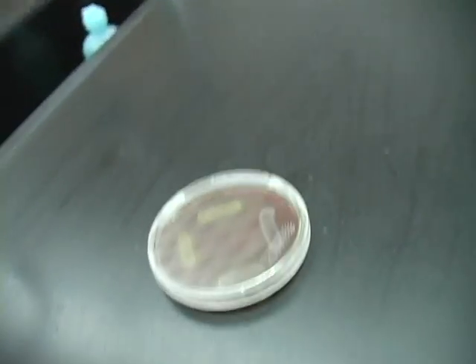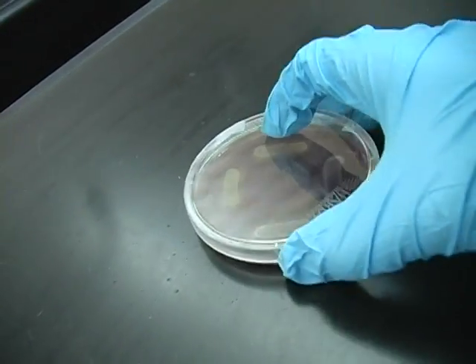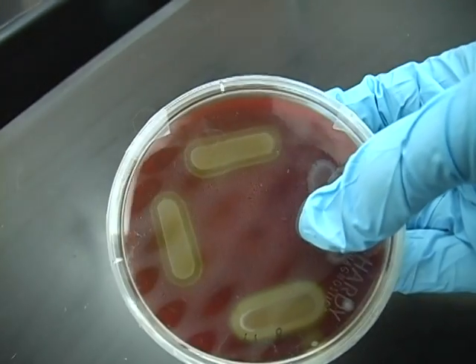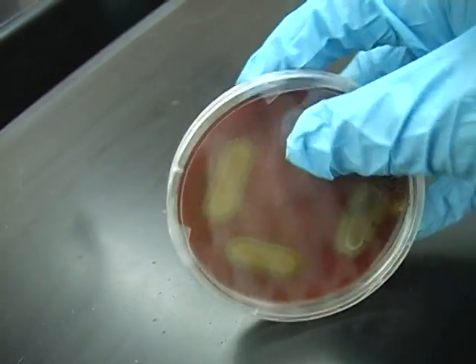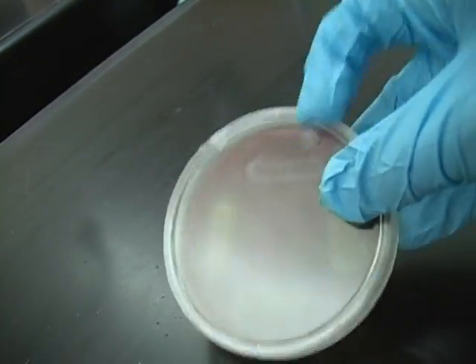This is a blood plate with 5% sheep's blood. It is a differential media for streps. Different streps release hemolysins, which lyse blood cells. This process is called hemolysis.